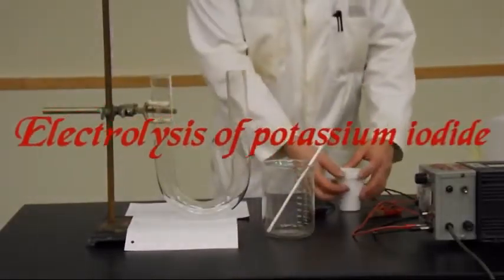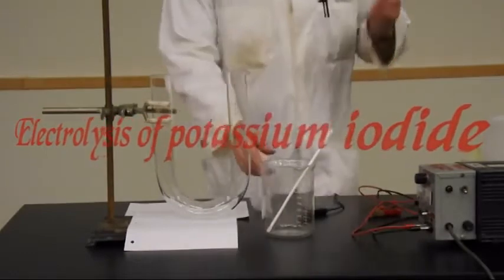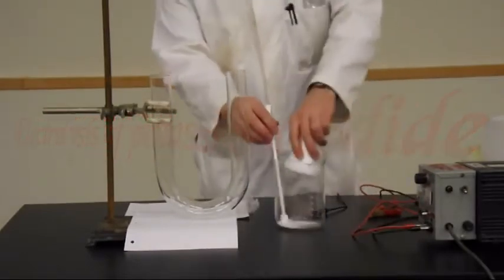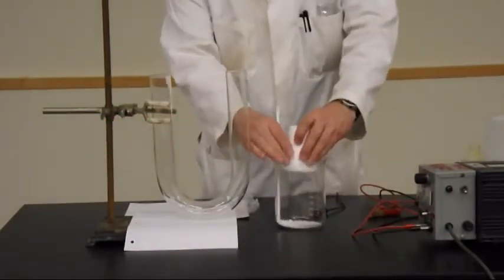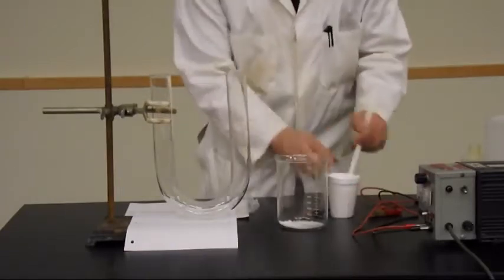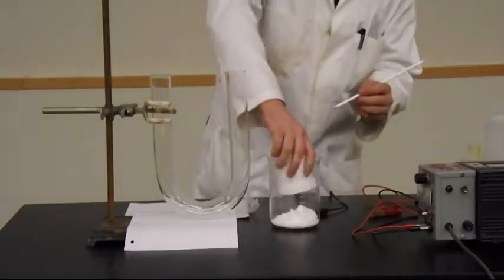The demo that we've got going on here is an electrolysis process. We have two moles of potassium iodide, and what we're going to do is just crush it. There we go.